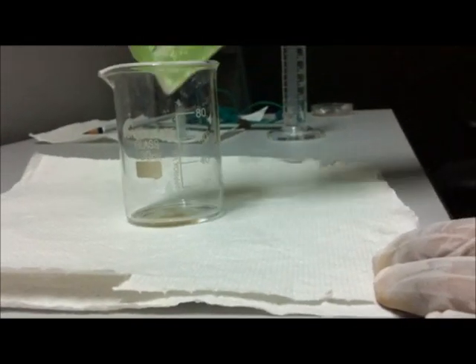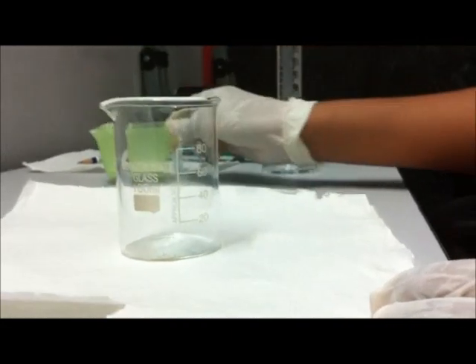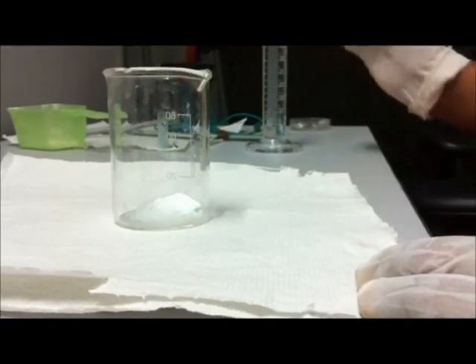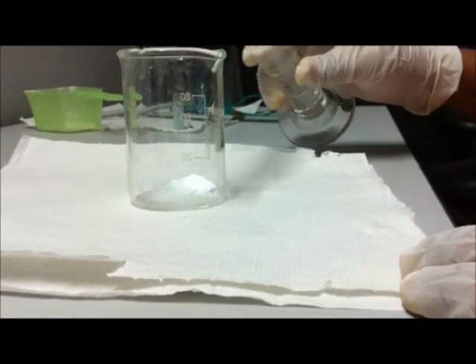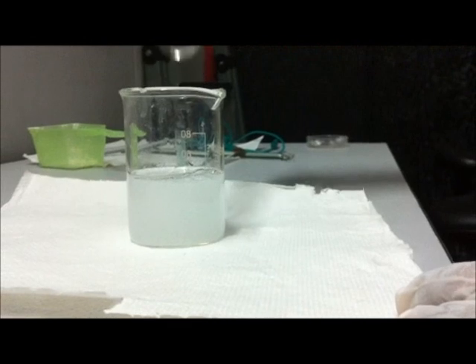Keeping the beaker in front, we add the magnesium sulfate to the beaker, then add the water, which I'll be adding in a moment. There's the water added.